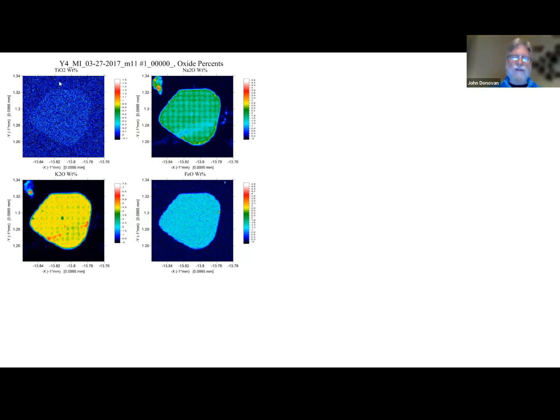So what's happening here, and I talked to Ben Hansen at Corning Glass, who was one of the people who developed the Gorilla Glass that's in all our cell phones, and that's a very high alkali-rich glass, which makes it shatter resistant. He says that what this is caused by is that you've got this moving beam, and then you're dragging along the subsurface electron charge. So I should say you've got this moving subsurface electron charge that is dragging this sack of sodium and potassium ions. And every once in a while, that envelope of ions gets too big, and it just drops off. And it's an amazingly regular process.